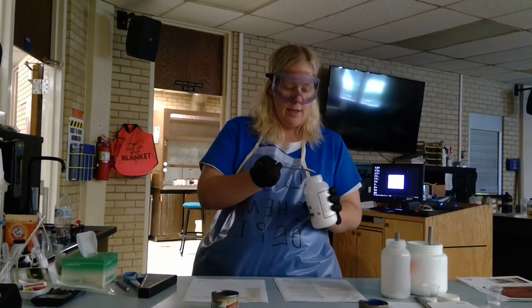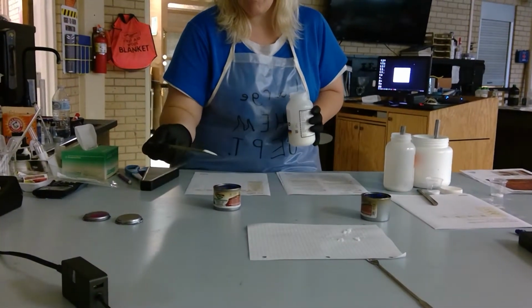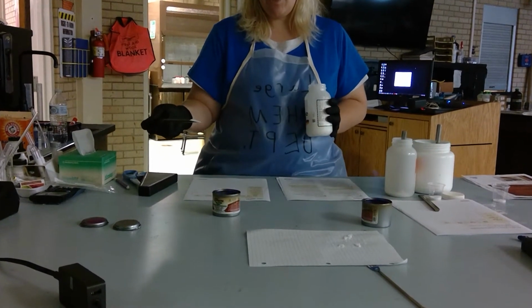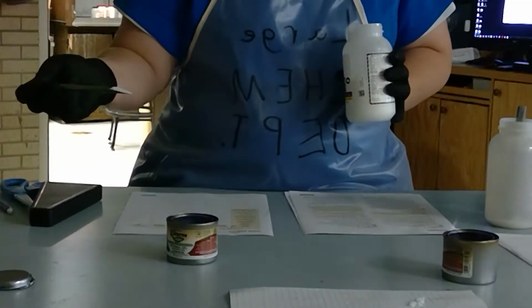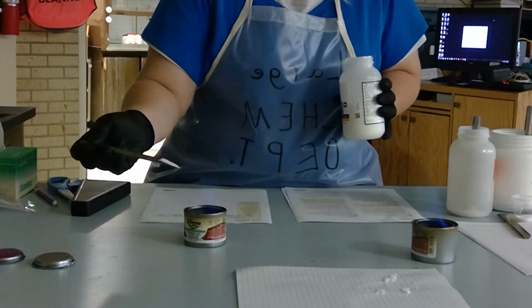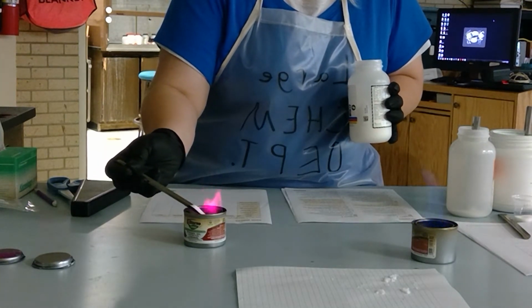In order to make that hopefully a little bit easier, I'm going to take the first sample here, it's a white solid, and I'm going to stick this in the flame. What I want you to know right now is look at the blue color flame, and that's just pure sterno. Okay, I zoomed in too far. What I'm going to do now is add this to the flame, and you see that reddish color.